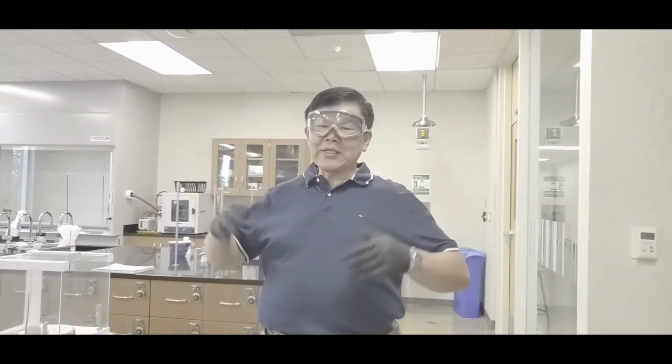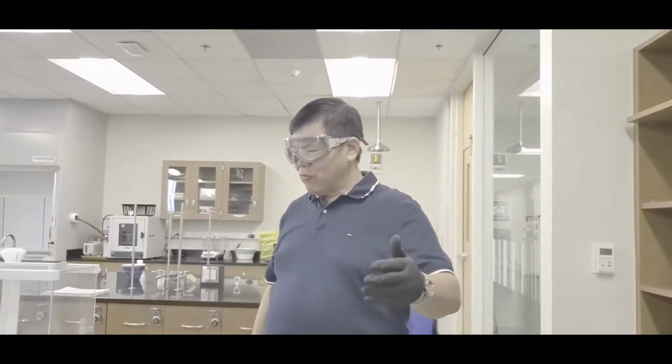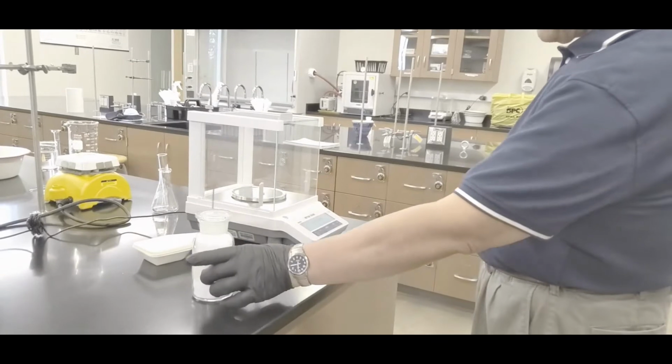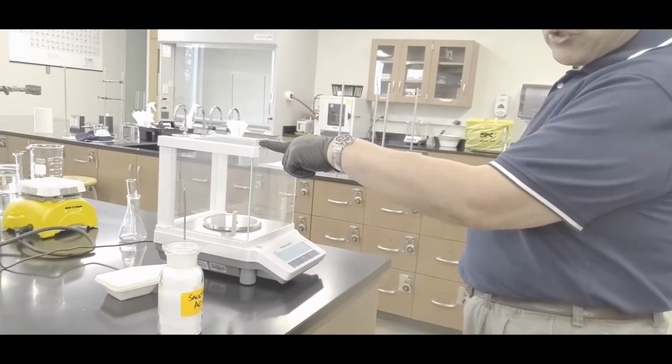Okay. All right, class. I've just explained the concept. Now, the next thing is I'm going to show you guys what kind of equipment you're going to be needing for this particular lab, okay? So here we go. What happened is you'll need some salicylic acid, okay? And then of course it should be weighed by an analytical balance, okay? Hey, you guys make sure you zero the balance.